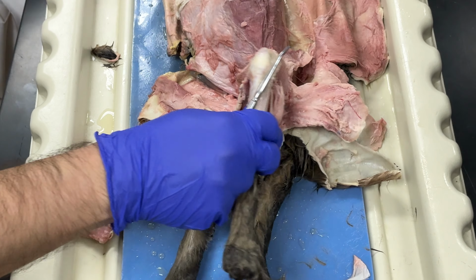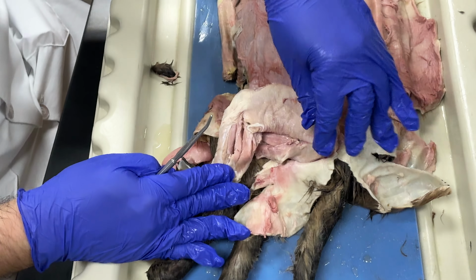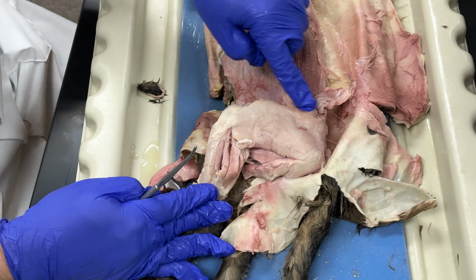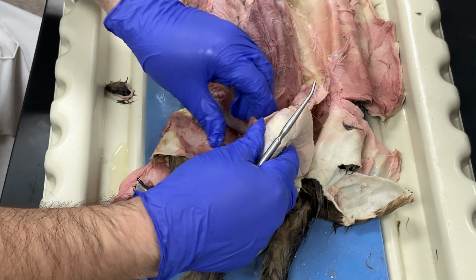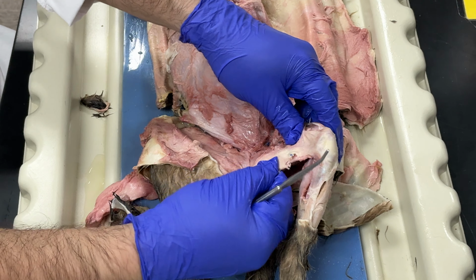So let's look at the leg of the cat. So we're looking at the side of the cat leg. So this is lateral, so this is on the side. This large muscle here is called the biceps femoris. So this is the biceps femoris. And if I look on the inside of the cat leg, I have a muscle right here, this one that I didn't really separate too well. This is the gracilis muscle. So this is on the inside, the gracilis muscle.